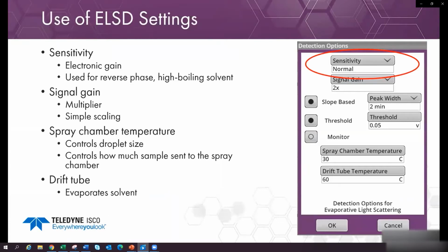Using the ELSD settings, the default settings will work well probably 99% of the time. You get good recovery and the peaks are on scale. Sensitivity is an electronic gain, and you set it to normal for normal phase and high for reverse phase. Teledyne ISCO columns have RFID tags which allow the system to set this parameter for you, and you can also set it for high with solvents with high boiling points.